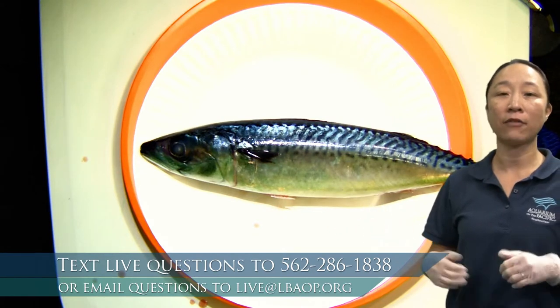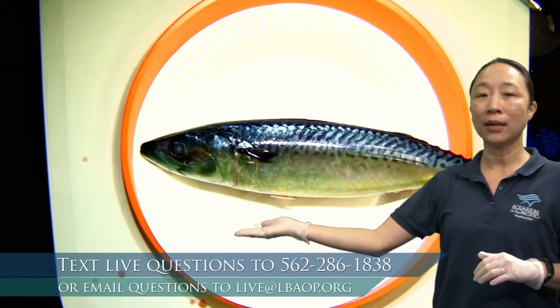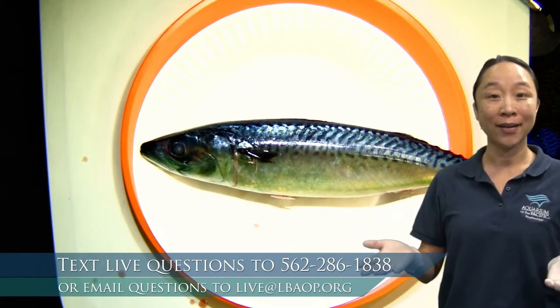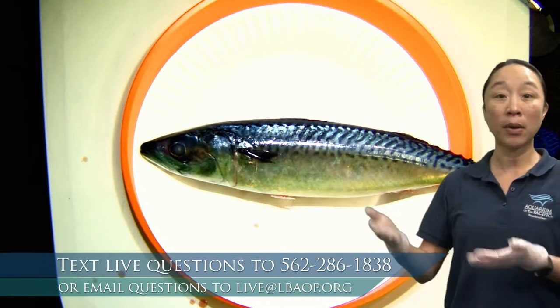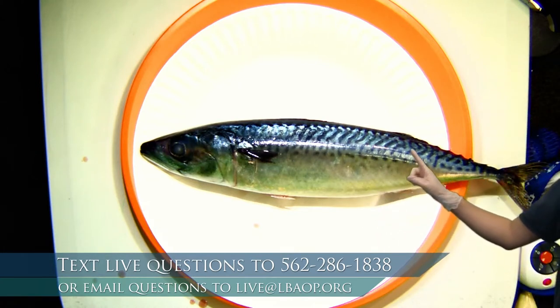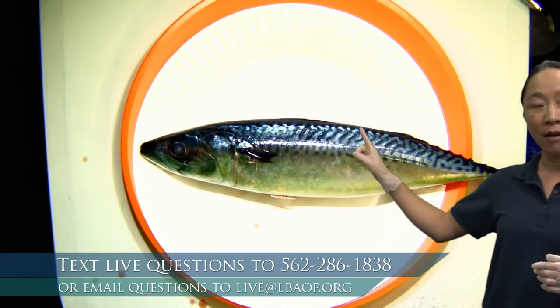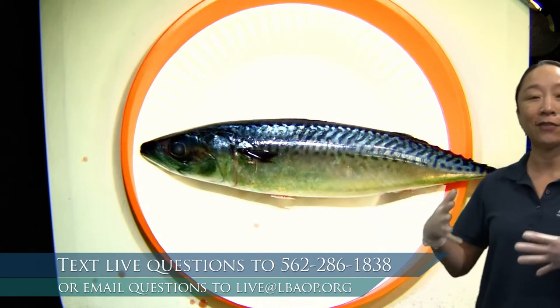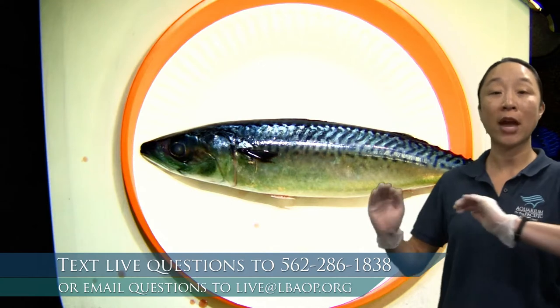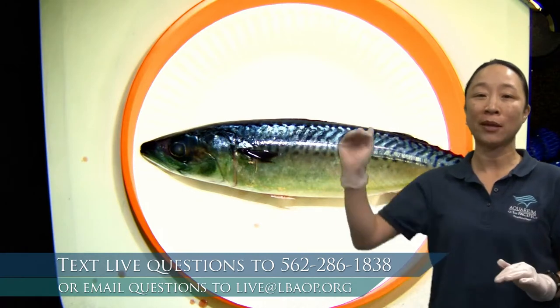You're going to notice countershading in a lot of animals — think about ocean animals with a darker top and lighter belly, like a penguin or an orca. Not just fish, but even birds and mammals have this coloration in the ocean. The other thing I noticed about the colors is that wavy pattern on the body. That pattern actually helps it blend in even more, because of the different shadows on the ocean floor and the way those shadows might move. So that pattern on the back is even better camouflage than just being dark on top and light on the bottom.